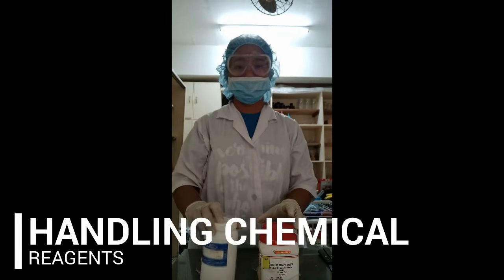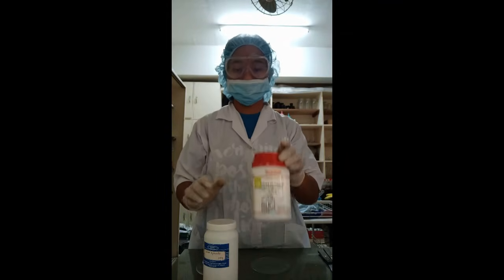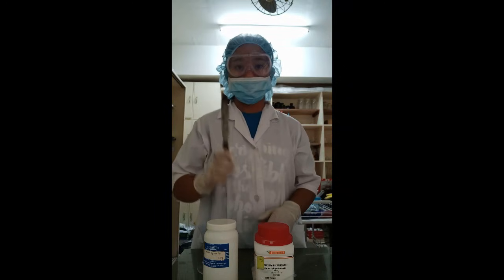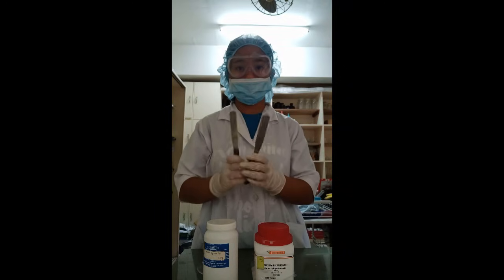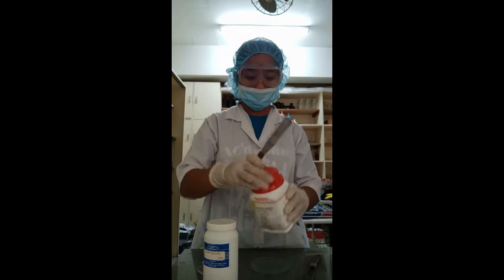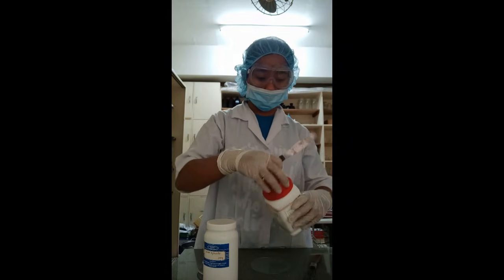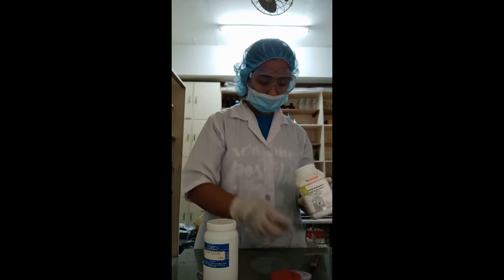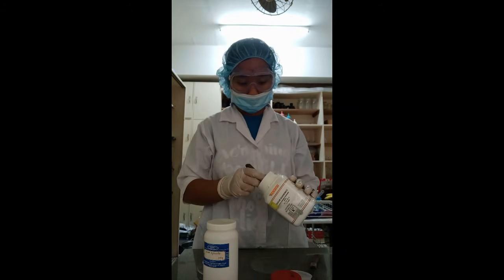Handling chemical reagents. When conducting an experiment, it will be necessary for us to obtain chemical reagents, both liquid and solid, from the storage area. The chemicals in the storage area have a degree of purity to be maintained. In order to avoid contaminating these chemicals, the following rules should be strictly adhered to.